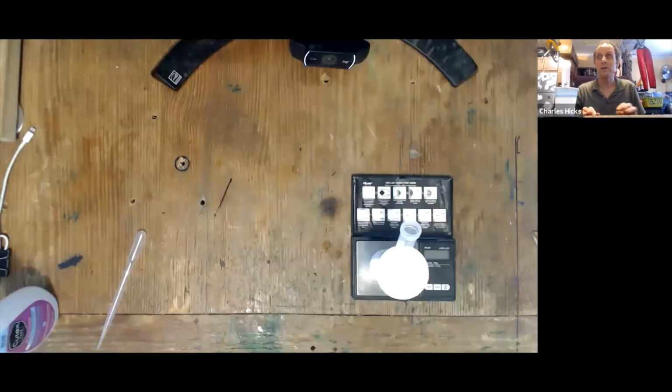Hi. Now, in this experiment, you do measure out the amounts of the triethyl citrate by drops, but we want to know the masses that those drops have. The reason we use drops is that some of the amounts are too small to directly measure the mass on the scale. So that's why in this part of the experiment, we have to figure out the mass per drop.